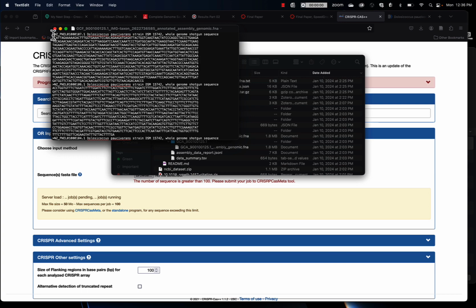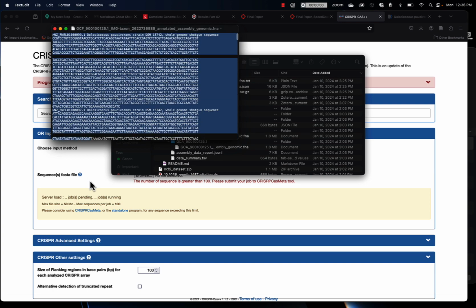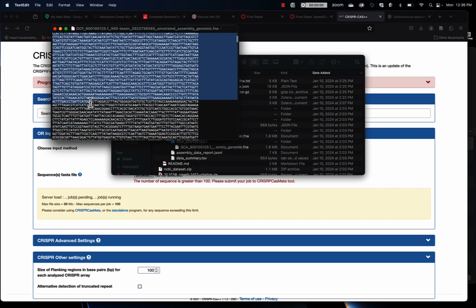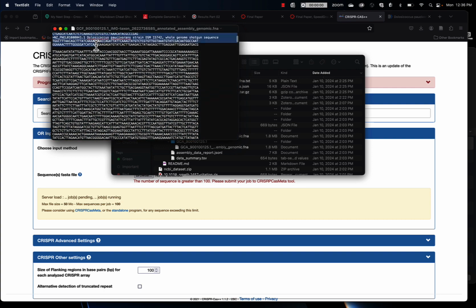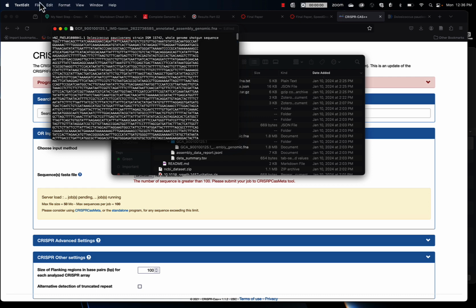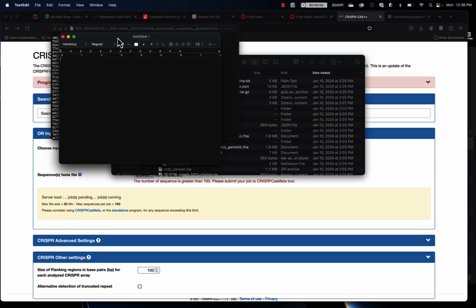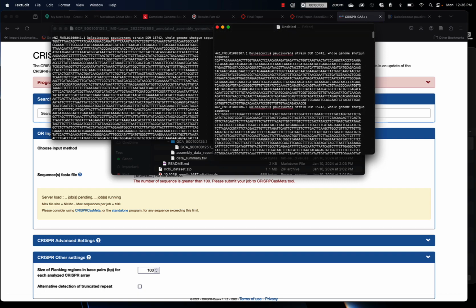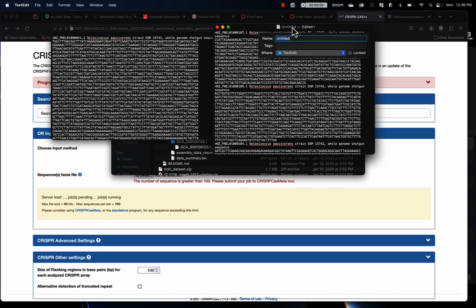So what we're going to do is select part of the genome, part of the sequences. And let's see here. It looks like those are some full pieces. I'm going to cut that out. I am going to make a new file. And if it looks like this kind of weird form, you'll want to go into Format, make plain text. I'm going to paste what I cut from the previous. So I pasted some sequences. I'm going to call this part 2, that's fine. And I'm going to save it on my desktop so I can find it.